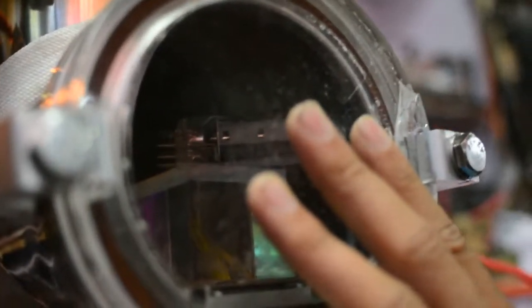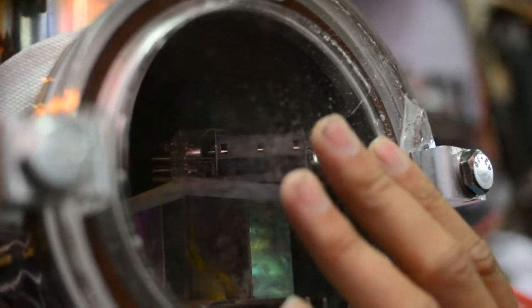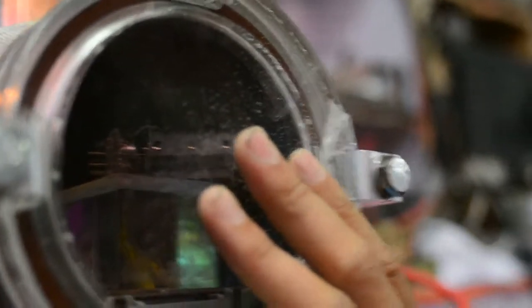If the vacuum system is not working well, the filament will burn up very quickly. Now I will turn on the power supply.